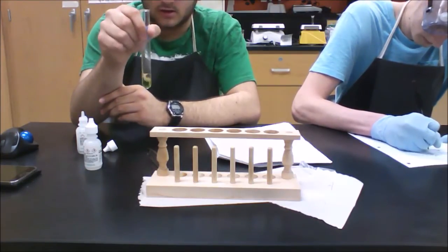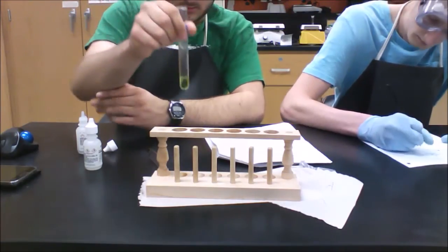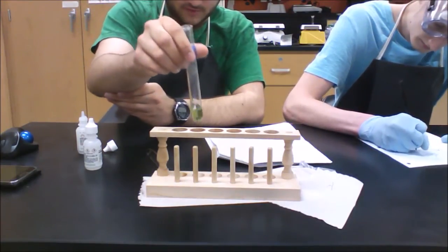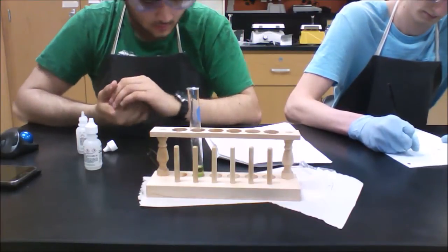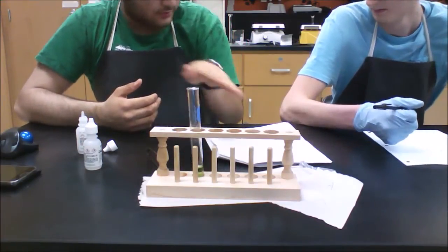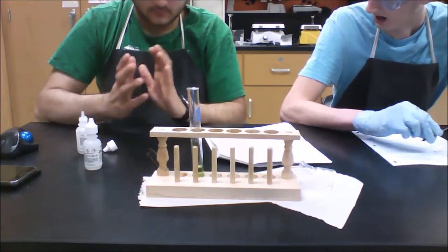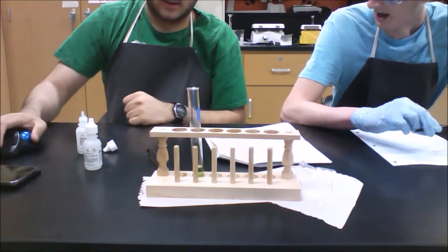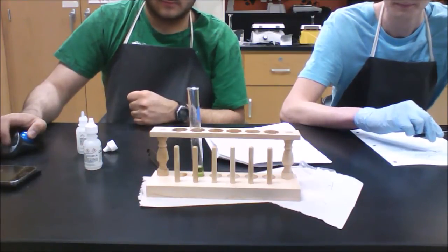It's a yellow-green color, as you can see there. So that shows you the shift of adding an acid, so it shifts back. So that's actually closer to our original color, so that shows that it's balancing out a little bit. So that's just an acid-base equilibrium, part A of the guided inquiry.